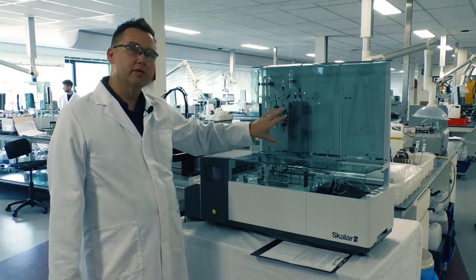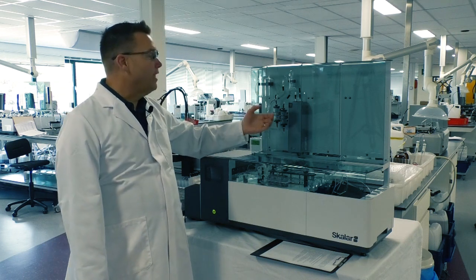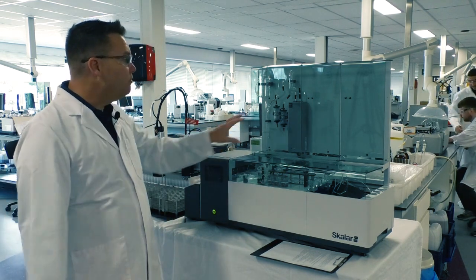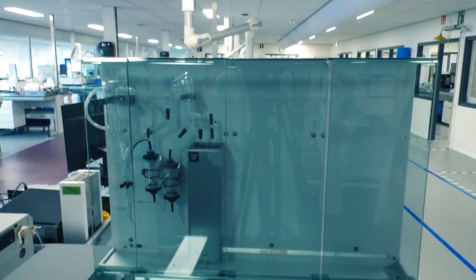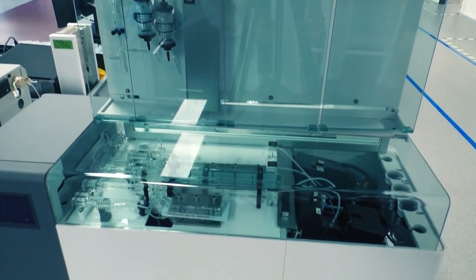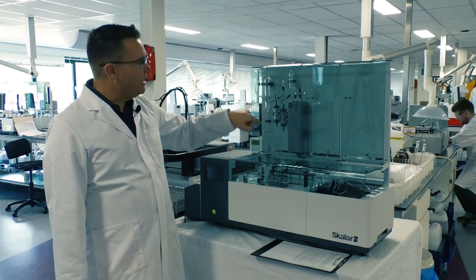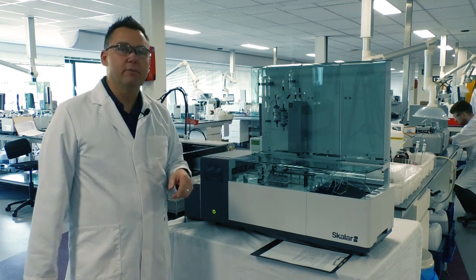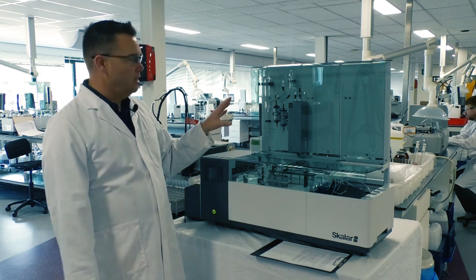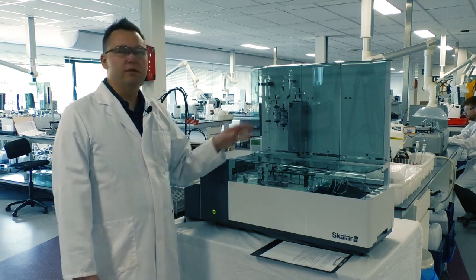This heat reactor here that's doing the distillation, all the oil is contained within the reactor itself. So we don't have any kind of external. As you can see, there's no external. Everything is contained within here. We have a circulating cooling that will basically either by a circulating pump, or we're also just going to use cooling water from my tap. And that will chill this back down and then just discharge back into my sink down to the waste. So basically, it's a very simple process of our system. There's nothing external, as I mentioned, that takes up space with any of the distillation process.